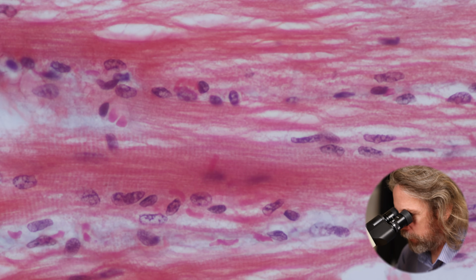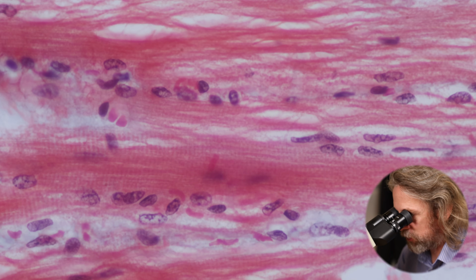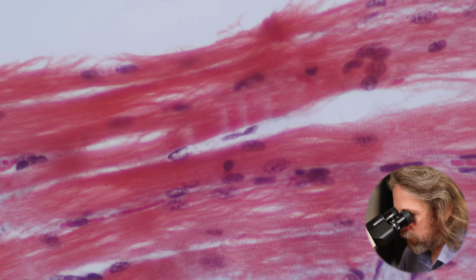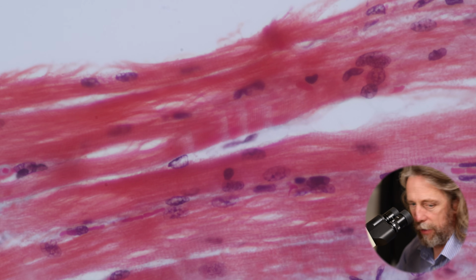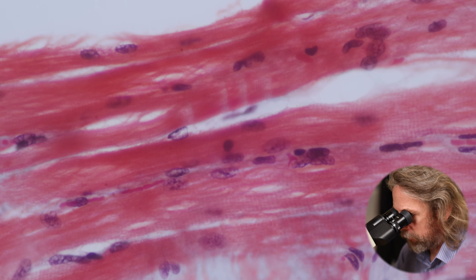How about that in the middle there? See some striations, some stripey, some bands there. I can see most of that up there. Also in there. That's quite heavily stained. I'm going through the focal plane just a tiny bit to try and help. So they're very, very faint striations.